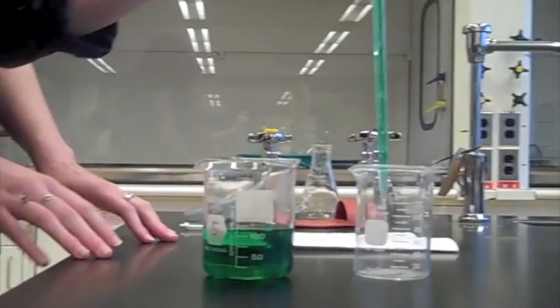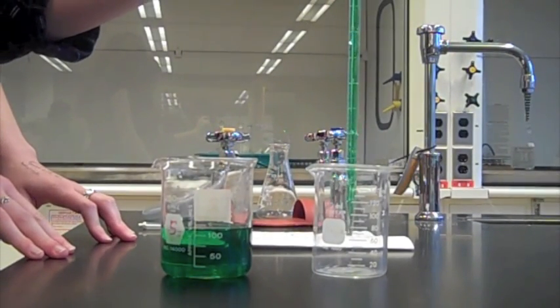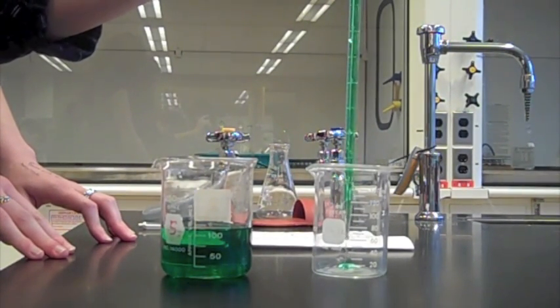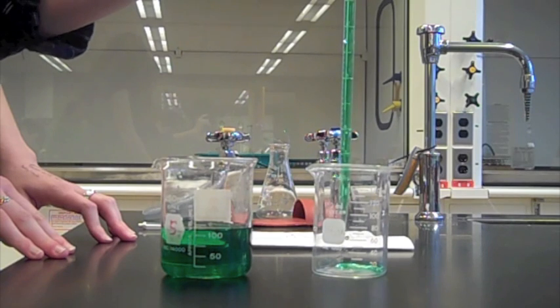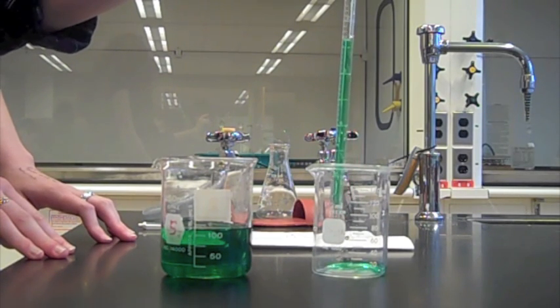So you transfer to the other cup and take your finger off so the five milliliters of solution is put into the other beaker.